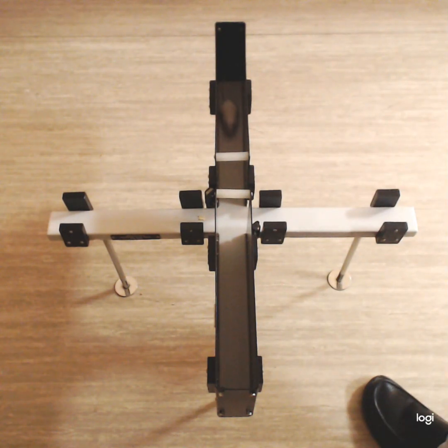As you can see, in the beginning it was in the open arm and trying to explore, okay, and even it fell down.